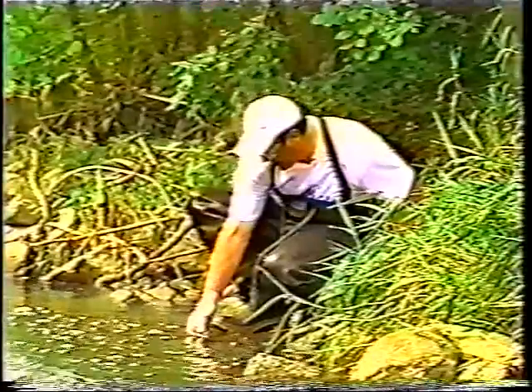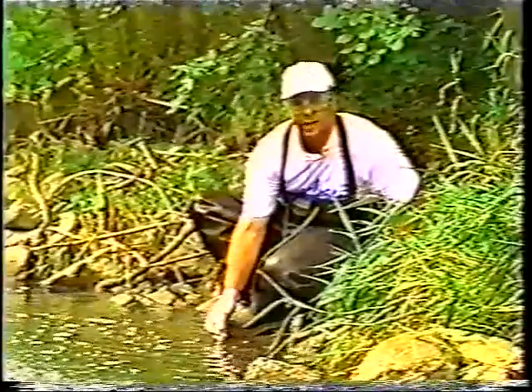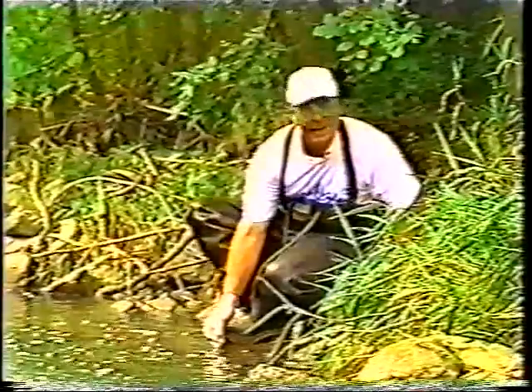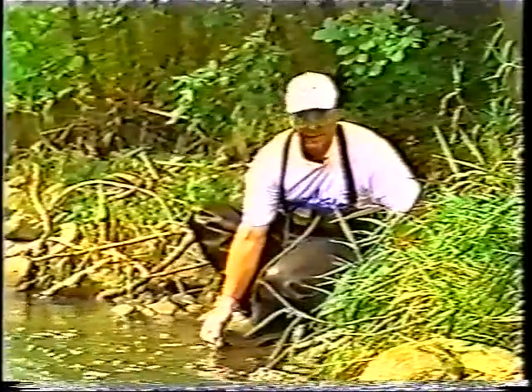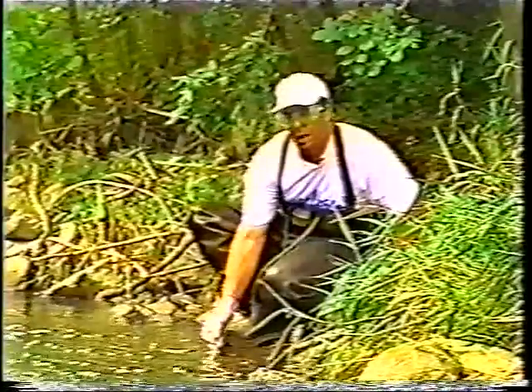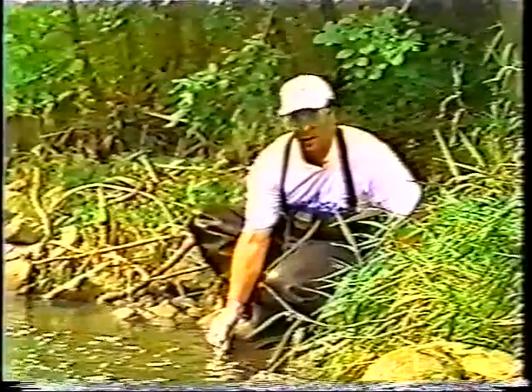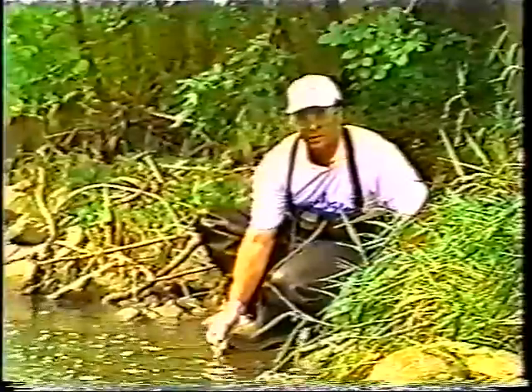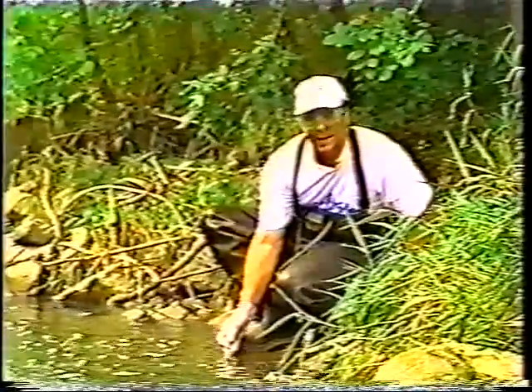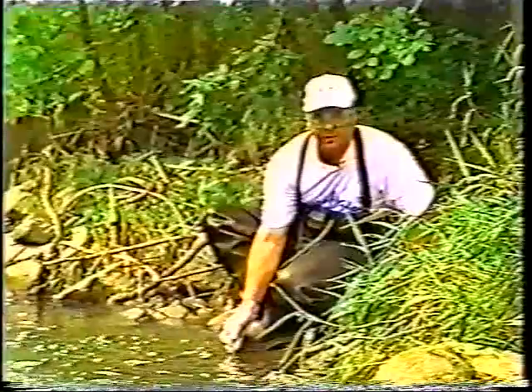In this particular case, the temperature is reading exactly 23 degrees Celsius. So I'll tell that to my lab partner, who will then record it down. I'll wait another 30 seconds to a minute, and I'll again record my temperature in degrees Celsius. And I'll do that for a total of 3 times at this particular site. Then I'll go to my next site, which will be approximately 1 mile away, and I'll repeat this procedure.